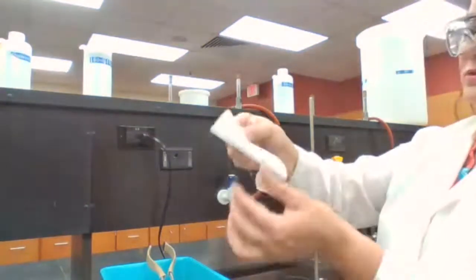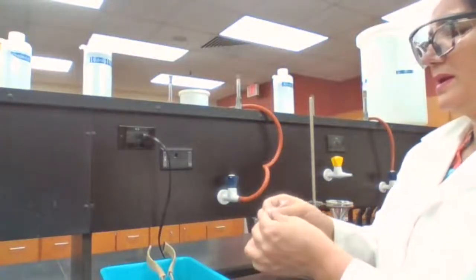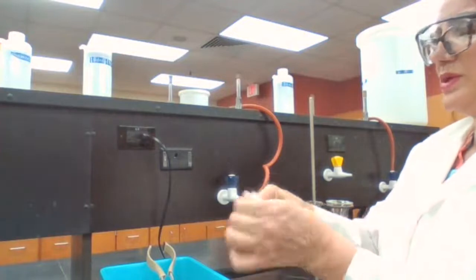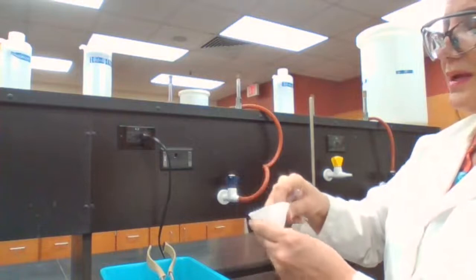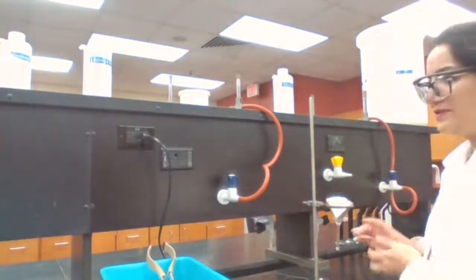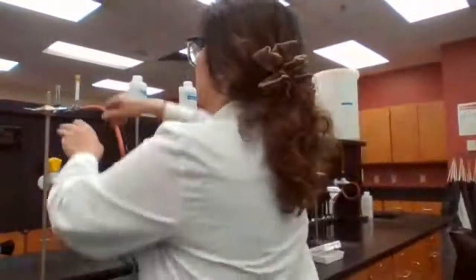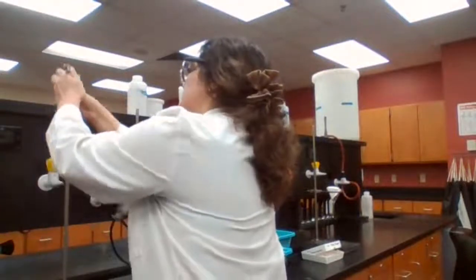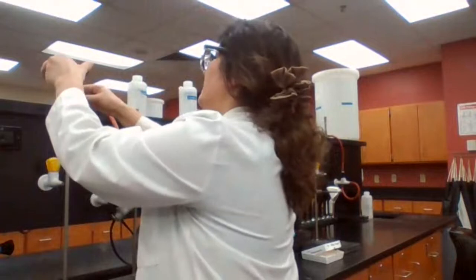So I'm showing you how to prepare the gravity filtration apparatus because we use it for another part of the experiment that I missed for experiment 2 anyway. So that is the gravity filtration. Just leave it there in case we need to use it. So I'm using the time to prepare for next steps. And also, I need to evaporate the liquid.